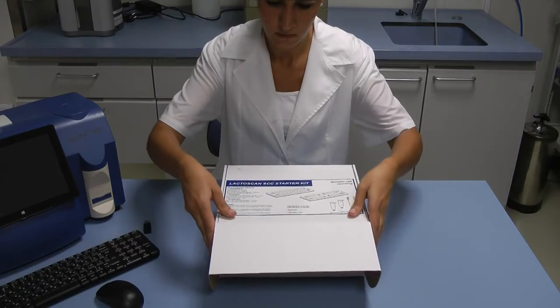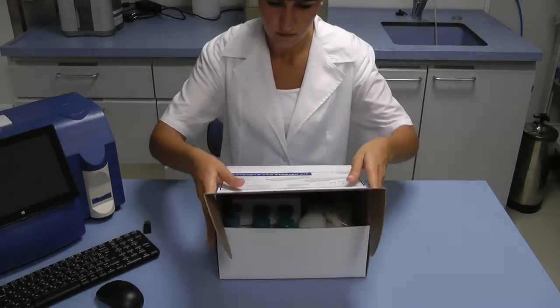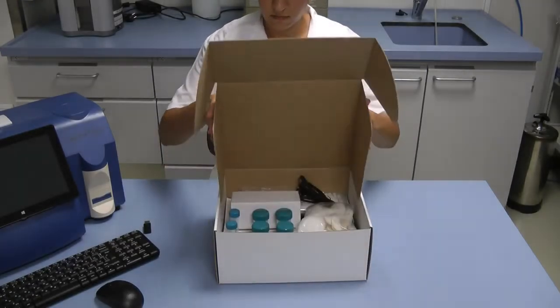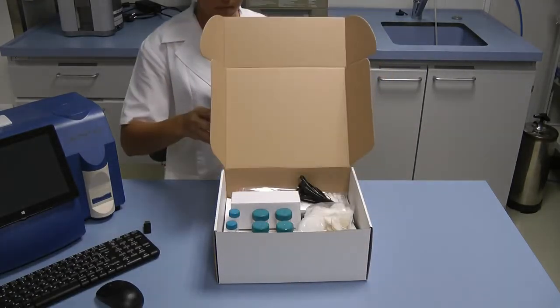Hello, in this working video we are going to show you how to prepare and make analysis of samples with the LactoScan somatic cells counter in few easy steps.